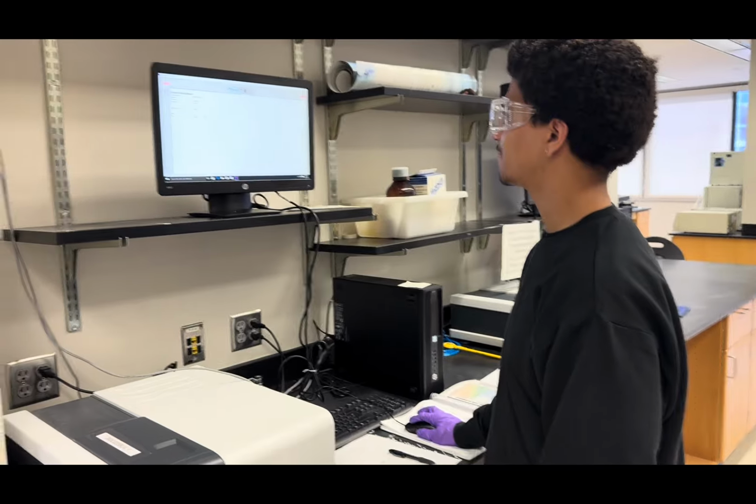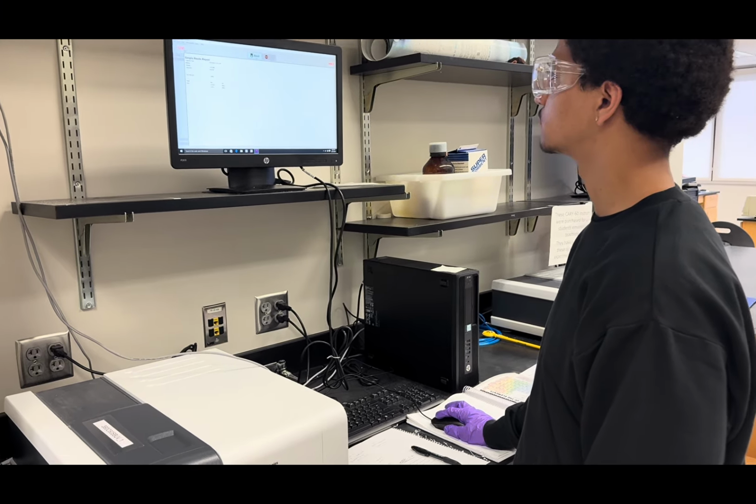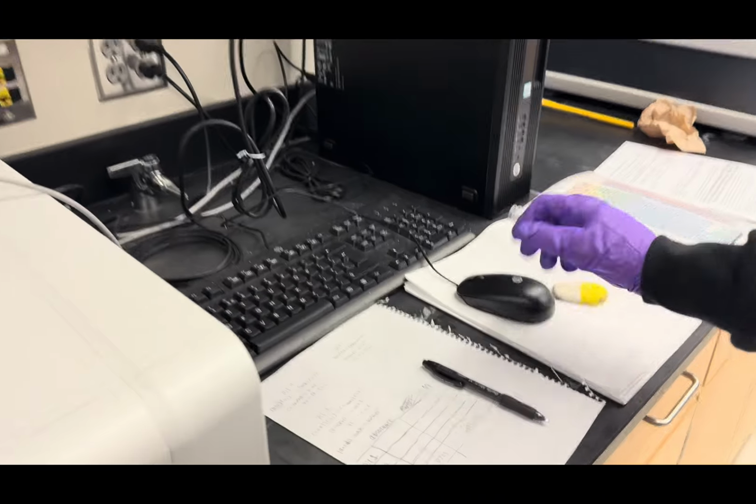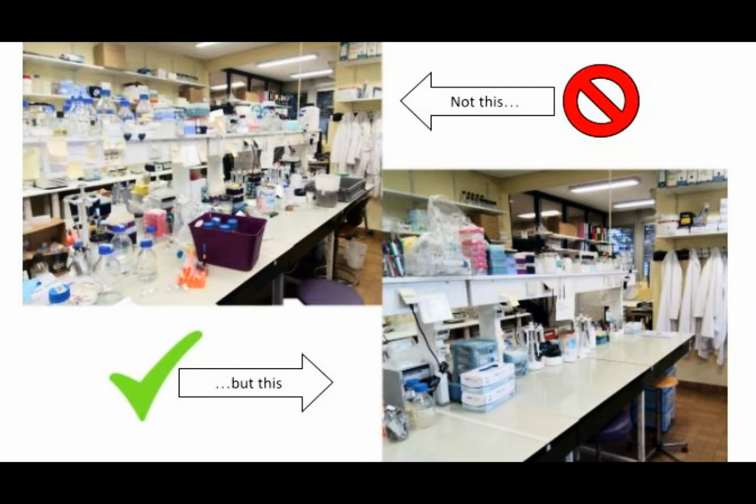After returning with the absorbance values from the spectrophotometer room and putting another glove on to replace the discarded one, do the final calculations and properly clean the lab space, making sure that the bench is completely clear.